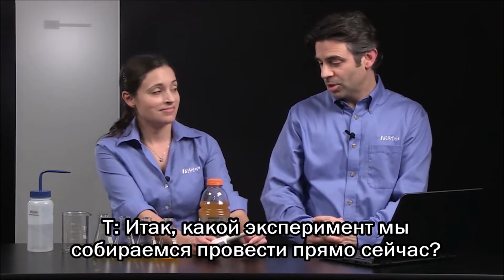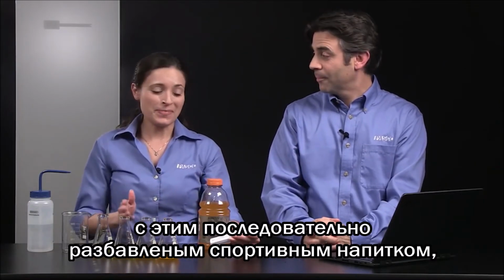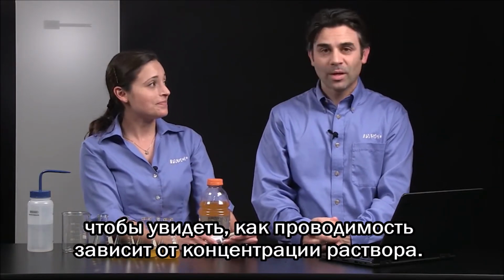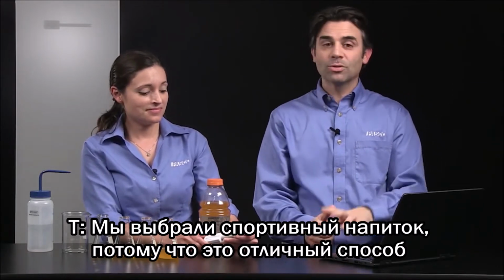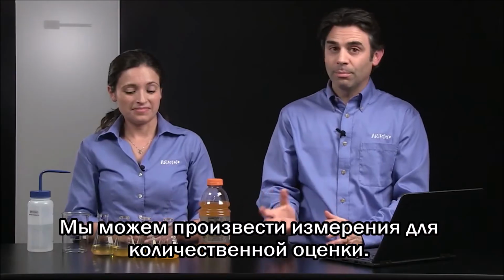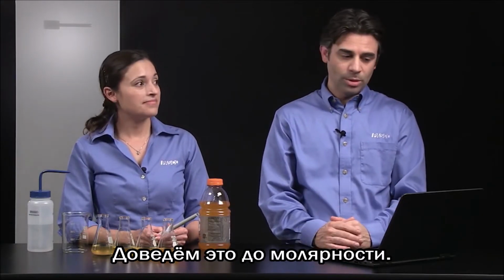So what kind of experiment are we going to conduct right now? Well, we're going to look at the conductivity of a serial dilution of this sports drink to see how conductivity is affected by concentration. Okay. And we picked the sports drink because it's a great way to introduce the idea of concentration, and it gives students a visual cue right off the bat. And we can make measurements so we can quantify that. And we're going to do that in percents before we get into molarities. We'll build up to molarities.